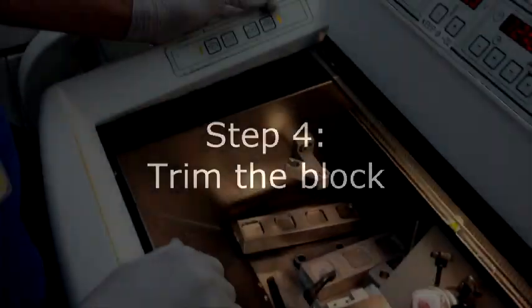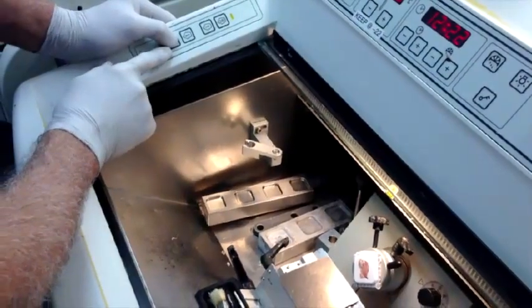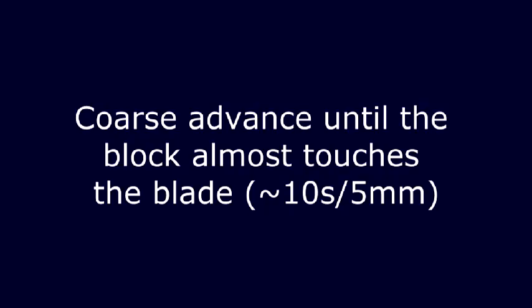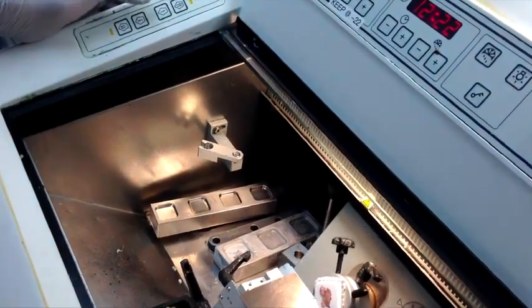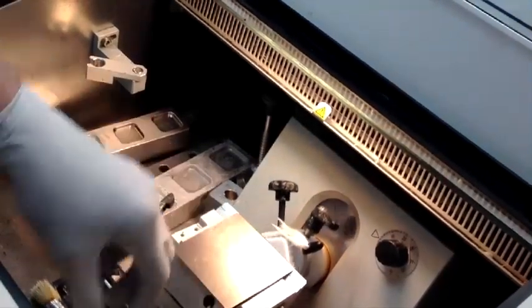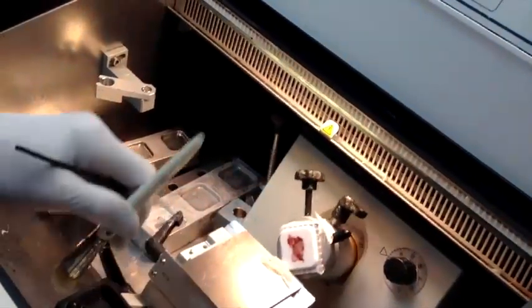I'm looking at the controls. I see that this little light is lit up, which means the block holder has retracted all the way back to the home position. I'm going to hold the rapid advance button down for about 10 seconds, which is going to bring this out about 5 millimeters. You can see it has advanced the block pretty close to the knife. As I bring it down into position, I'm testing to find where the block is, starting the trimming and facing process. Now you can see that the entire surface is being cut and shaved.